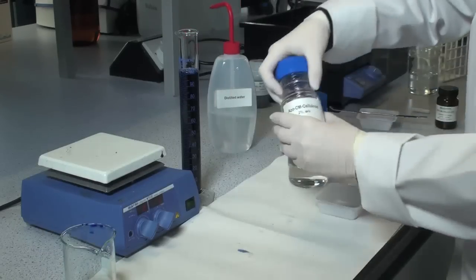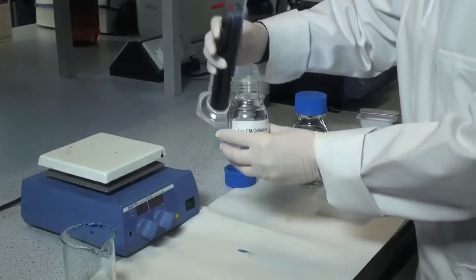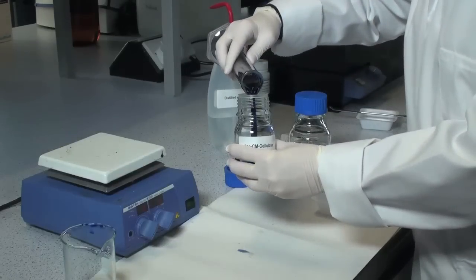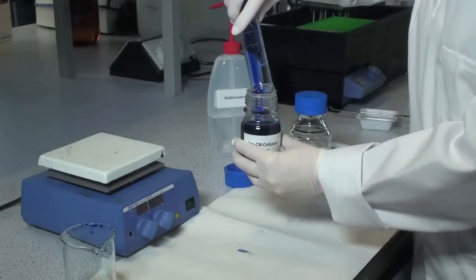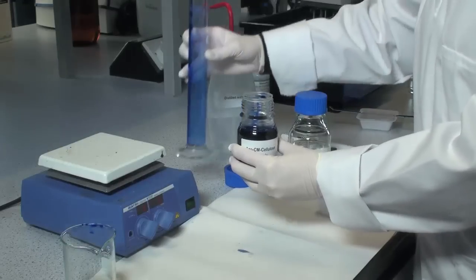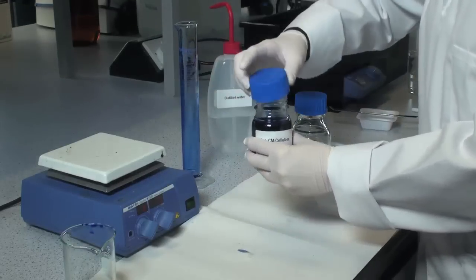The substrate is then transferred into a 100 ml Duran bottle and for longer term stability, two drops of toluene can be added to prevent microbial contamination.